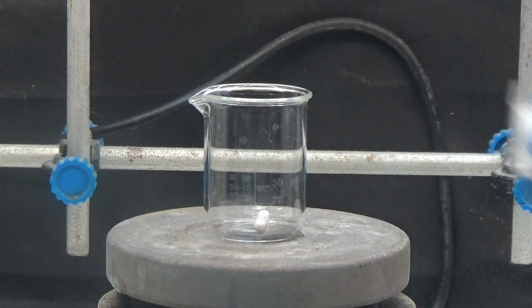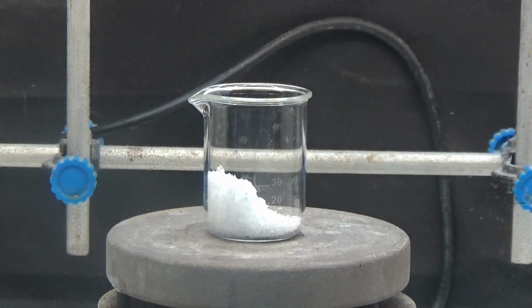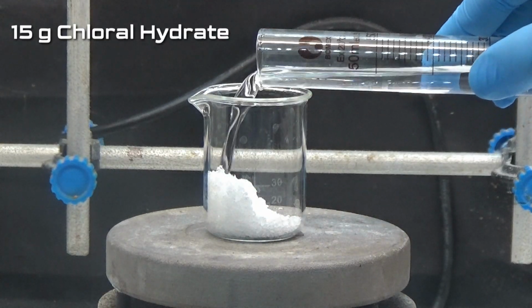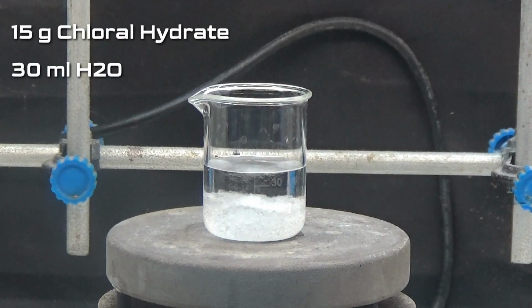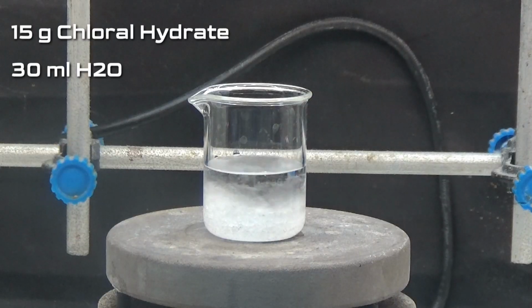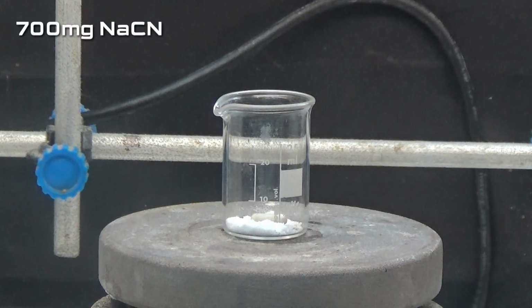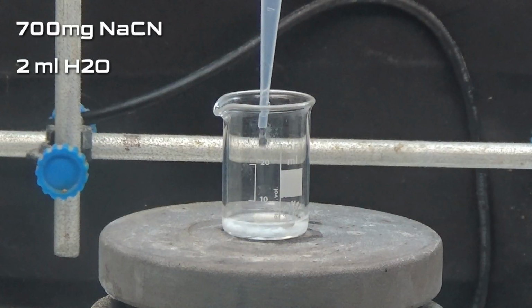First, we are going to obtain an aqueous solution of chloral hydrate. Dilute 15 grams of chloral hydrate in 30 ml of water in a 50 ml beaker. Prepare a solution of 700 mg of sodium cyanide diluted in 2 ml of water.